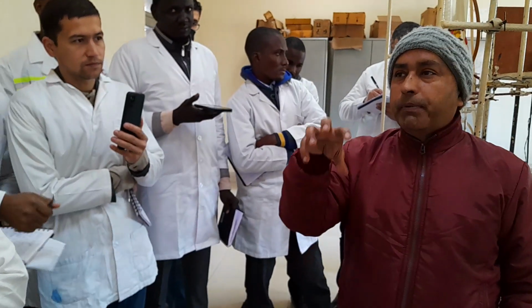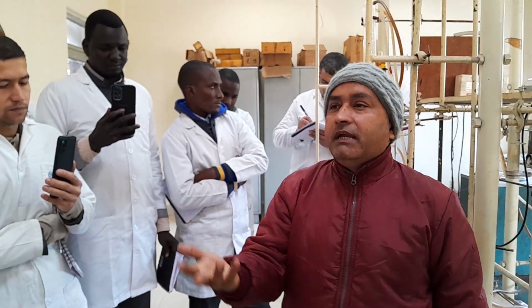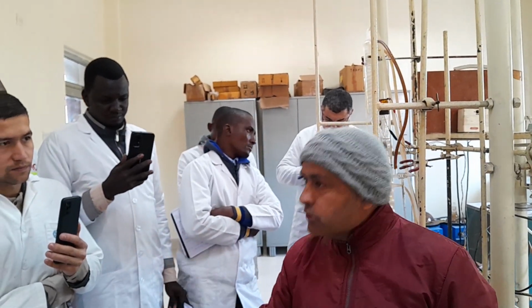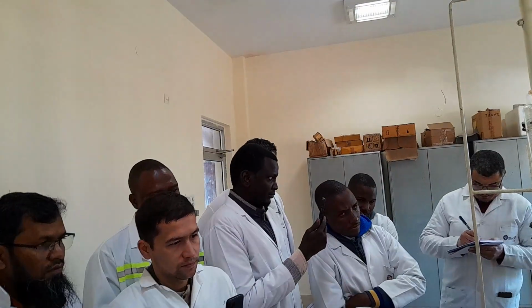If that vapor pressure is more than 82.7 kilopascal, we cannot do anything, but we can mention in the report that because the crude oil is not in stabilized condition, that is why the loss of this crude oil is this much. So this is the justification.